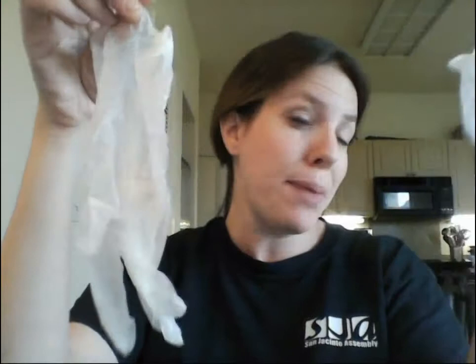So we want to get in gear. First of all, if you have hair longer than this, you want to put it up in a braid or ponytail, because you want it out of your way and you don't want chemicals getting on it. Second, you're going to want to wear your lab gloves, which should have come with your PPE set with your lab-in-a-box kit. Let's put on our gloves.